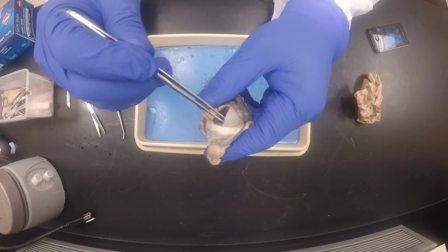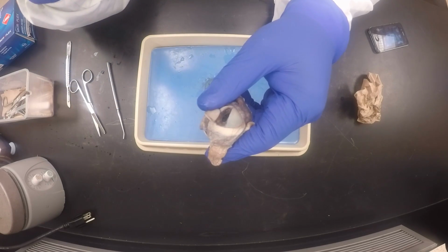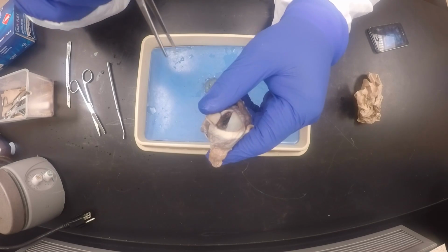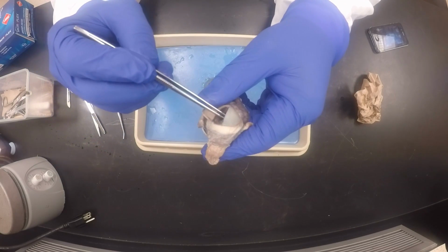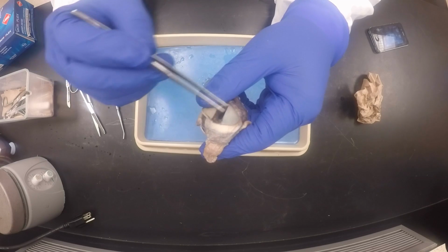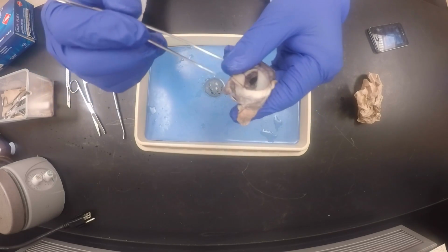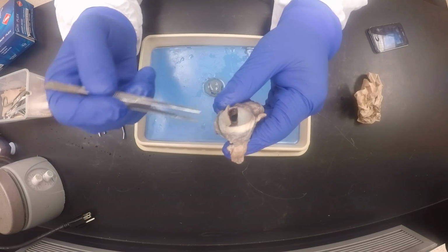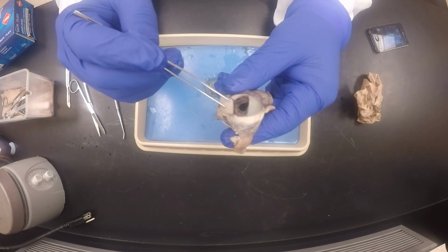This hole on it is the pupil, which gets dilated when you're in the dark by the radial muscles or dilator pupillae, or gets constricted in bright light by the circular muscles or sphincter pupillae, which we did in the lecture when we were doing the eye. So that's that, and this is the cornea, and behind it you can see maybe a little bit the white structure, and that's the lens.